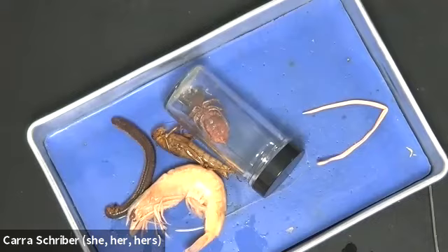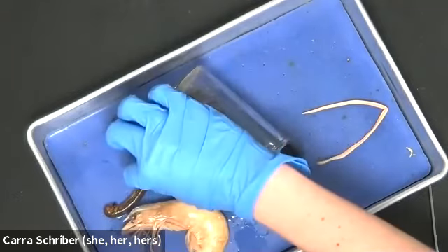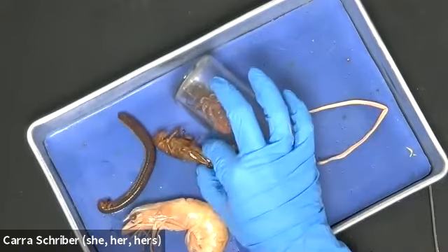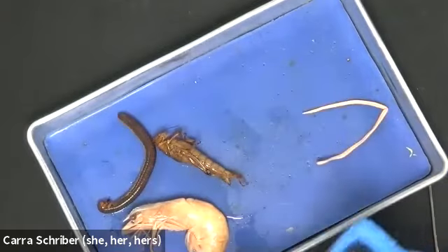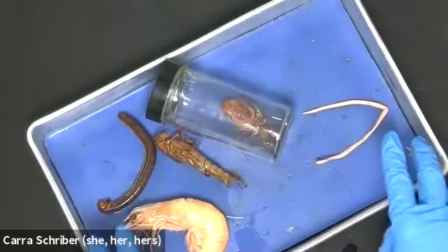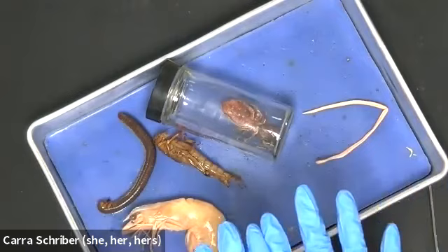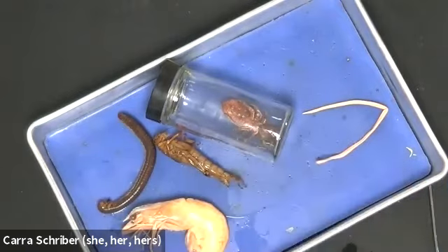And so that's a characteristic of arthropods, right? And so this outer layer gets shed. Okay, so all of these have that crunchy outer layer, right? And so I want to show you how different these organisms might seem, but they have that characteristic or that critical innovation in common. And so that's why they are most closely related to each other in the animal kingdom.